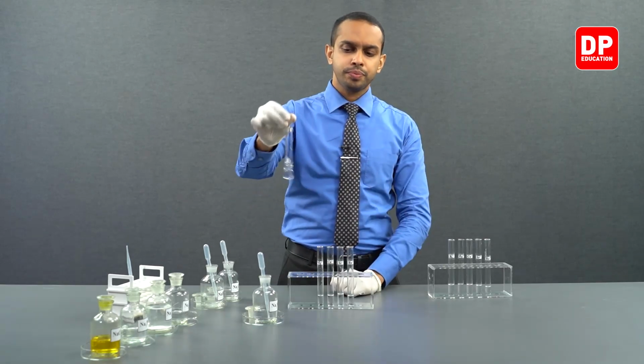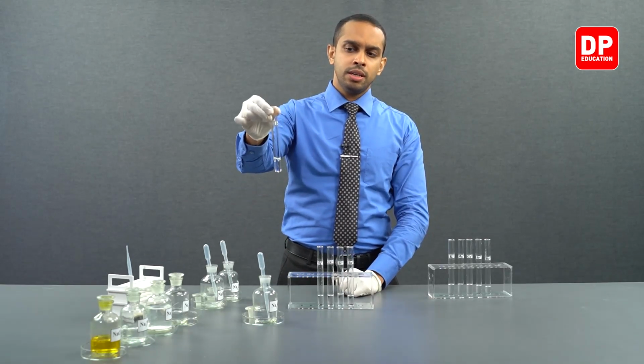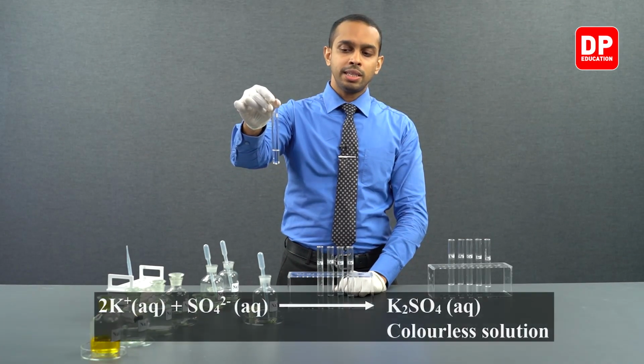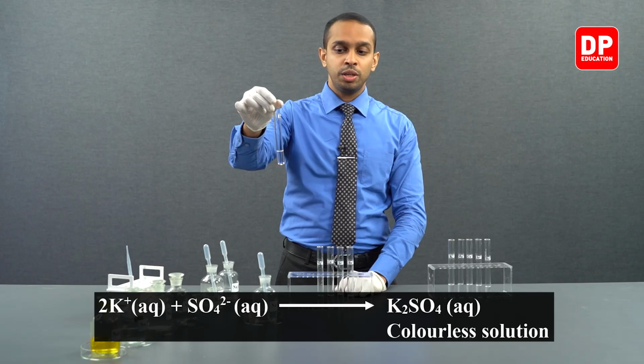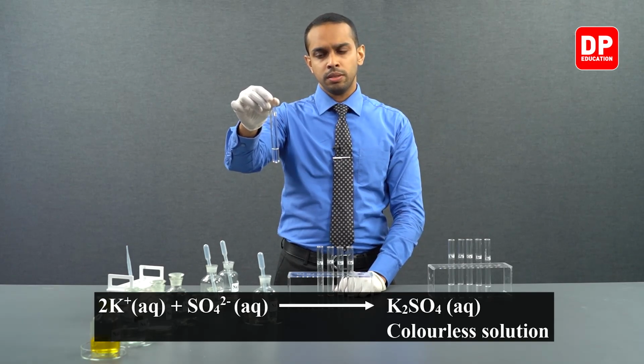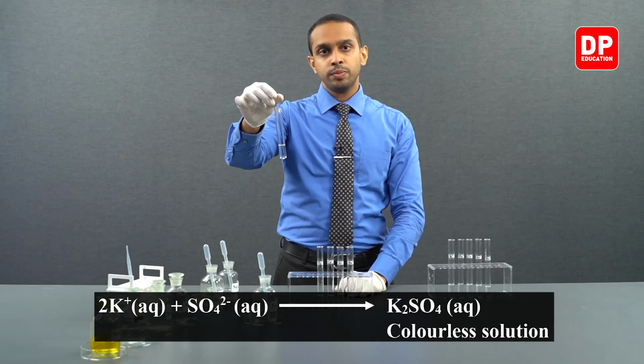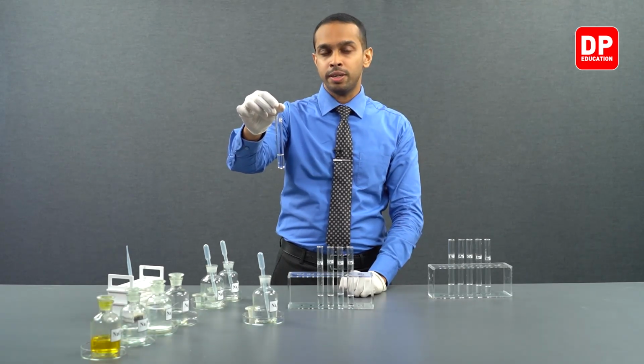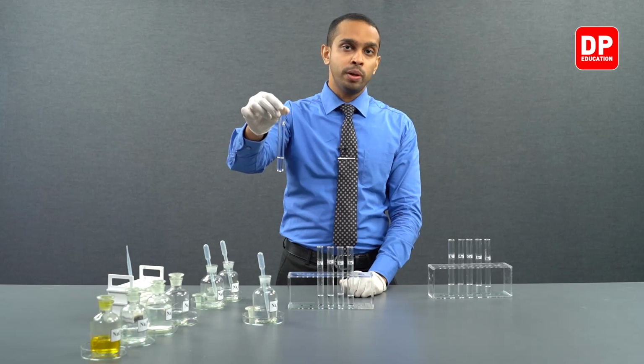You can see when I added sulfate ions to our potassium ion solution, we did not form a precipitate. In the presence of sulfate anion, potassium ions will form potassium sulfate, which is soluble in water.